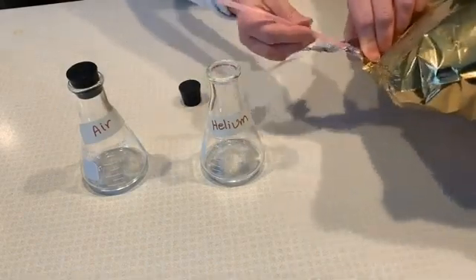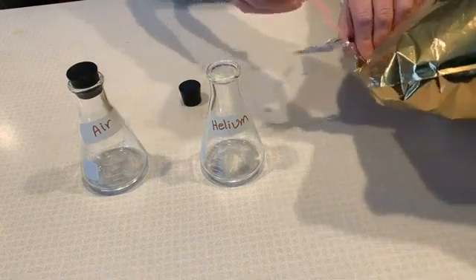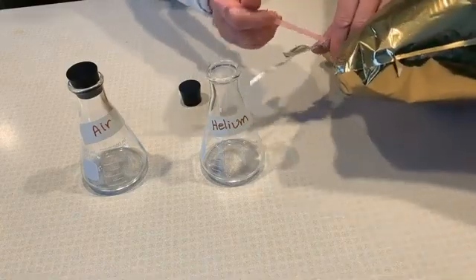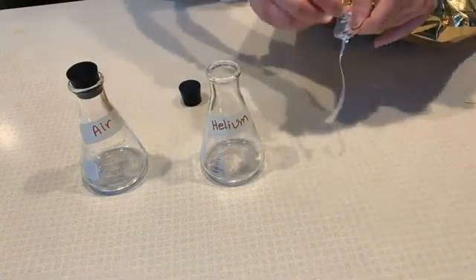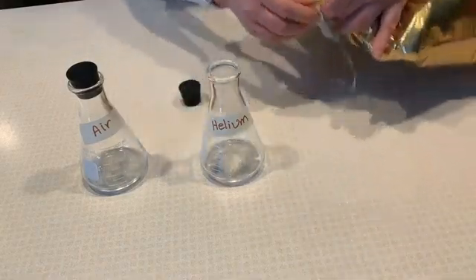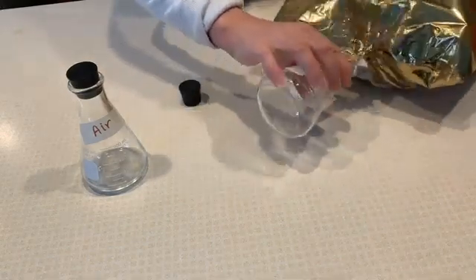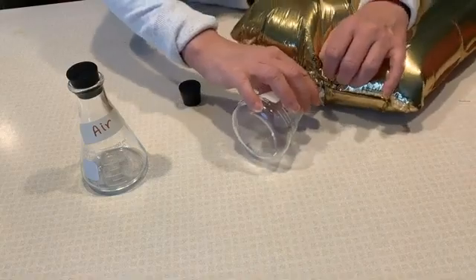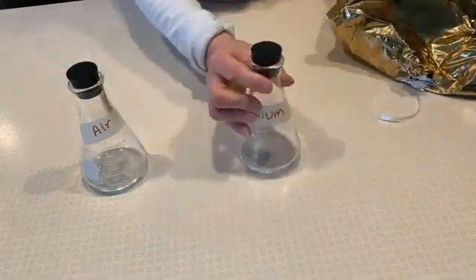In order to get the helium from inside the balloon to my flask, I'm going to use a straw and put the straw in the bottom of the balloon, push it all the way in, so I can feel the helium coming out. The scientist turns the flask sideways. And then I'll put the end into the flask and push down on the balloon — it's getting filled. And then I'll cap it off.